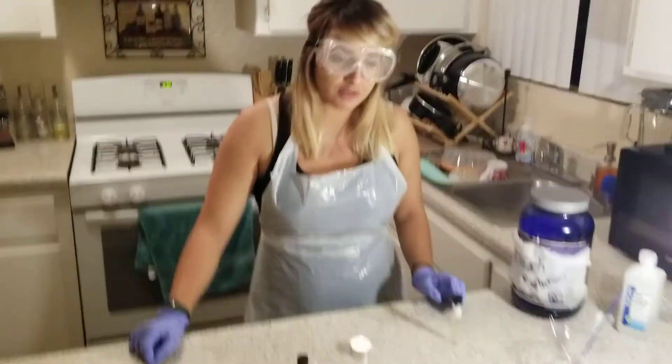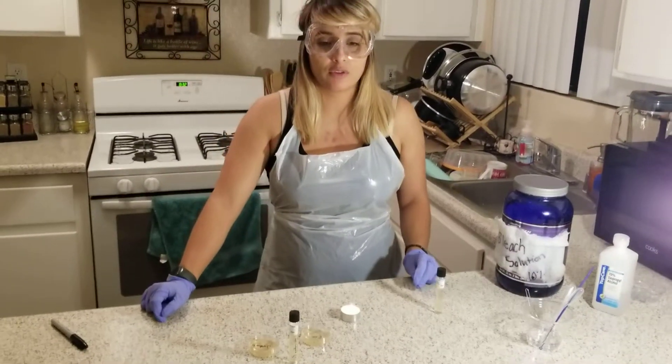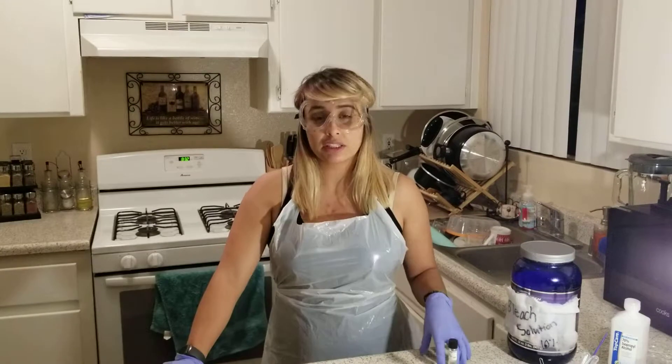In today's lab, the experiment is bacterial identification through functional media. Today's test is a motility test.